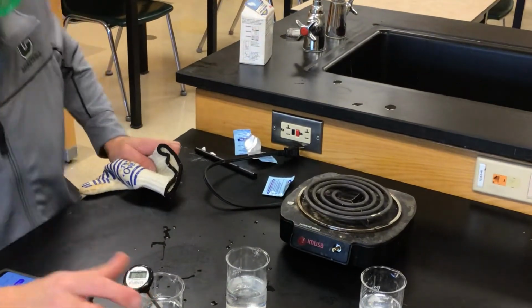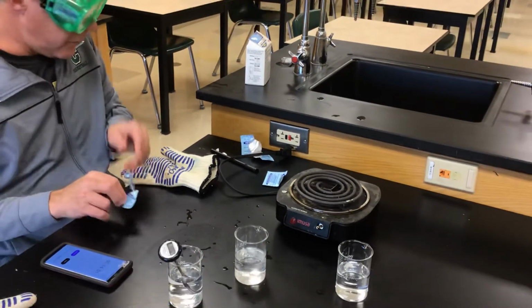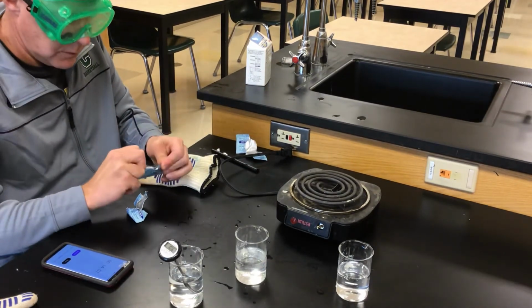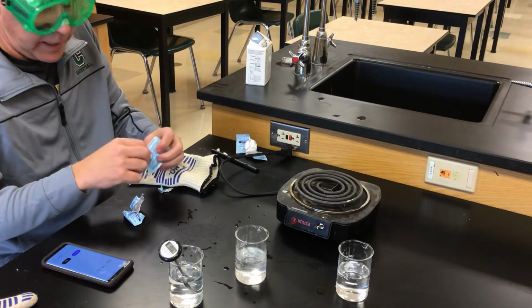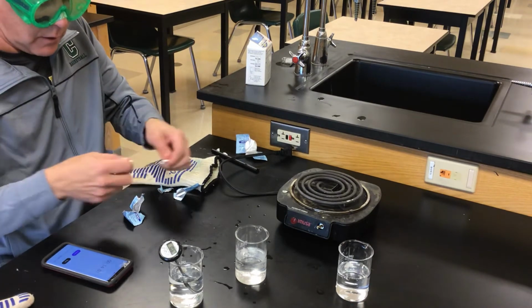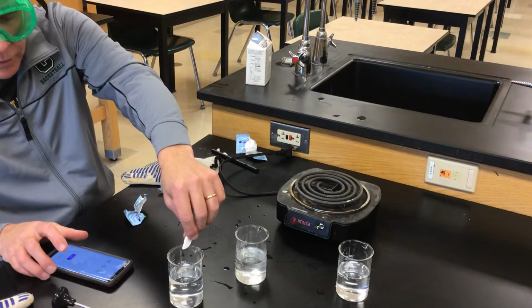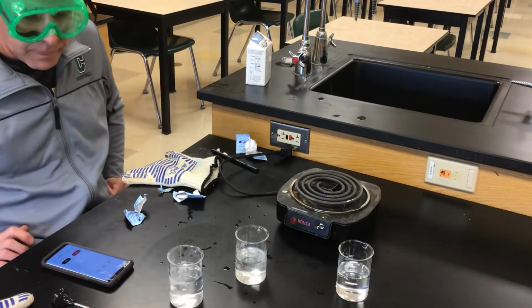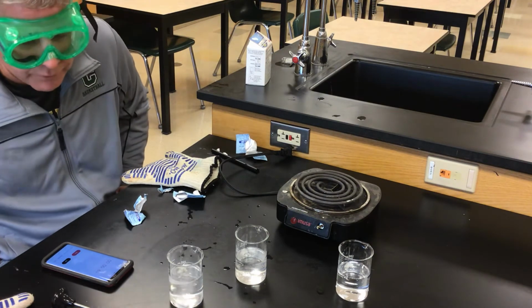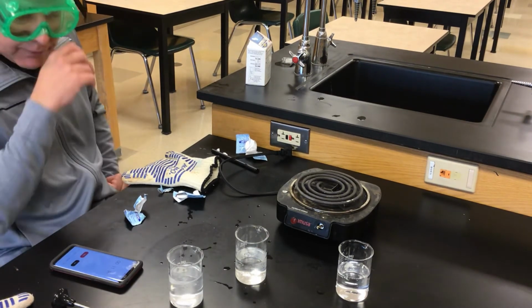So you can see the temperature of the water is 10.6. So we would do 3 of these at 10.6. We'll just do 1 for now. And again, this is a little more precise. We could call that 11 degrees, just fine. And now we will test the 11 degree water. Interesting that the Alka-Seltzer sinks in 11 degree water. I find that interesting. I've never really noticed that before in all the years I've done this. Something else we can think about, but obviously going slower.